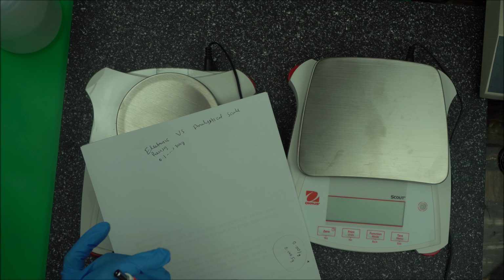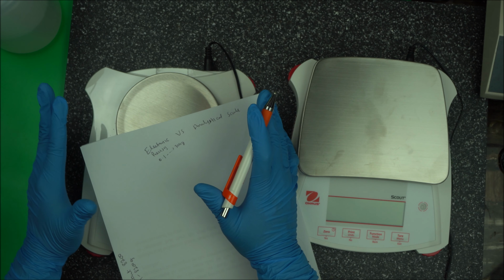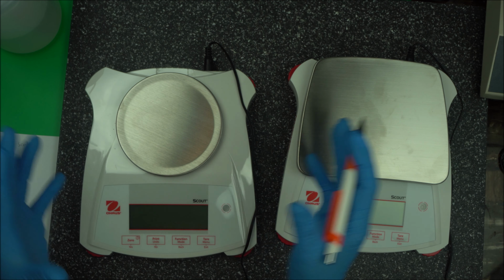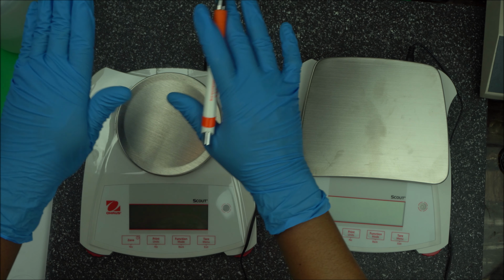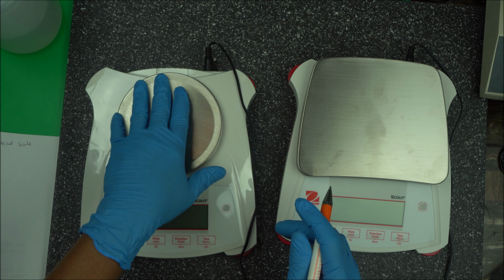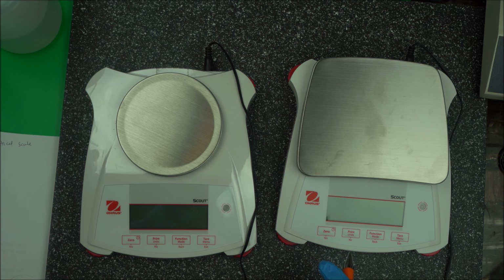Most of those scales are very expensive, and oftentimes they come with a shelf-like cover, because analytical scales are very sensitive to light and wind, so you want to minimize the amount of wind. They're usually small, very tiny, not like this. So if you take measurements like 0.0001, you need an analytical scale.